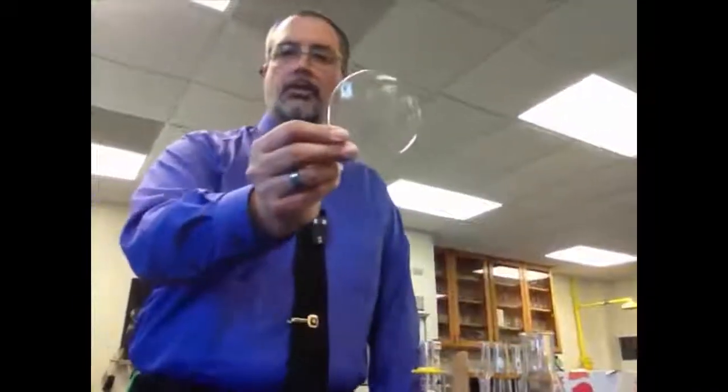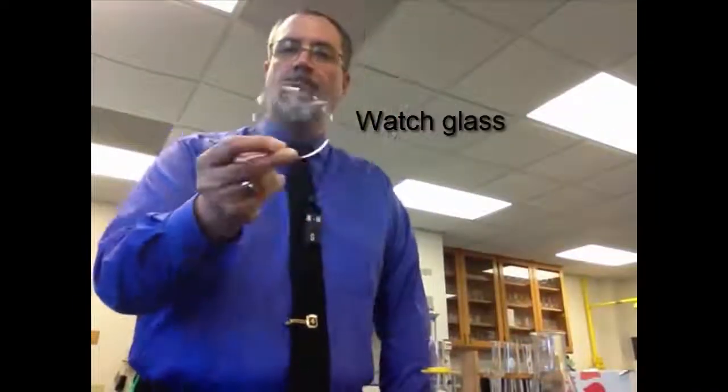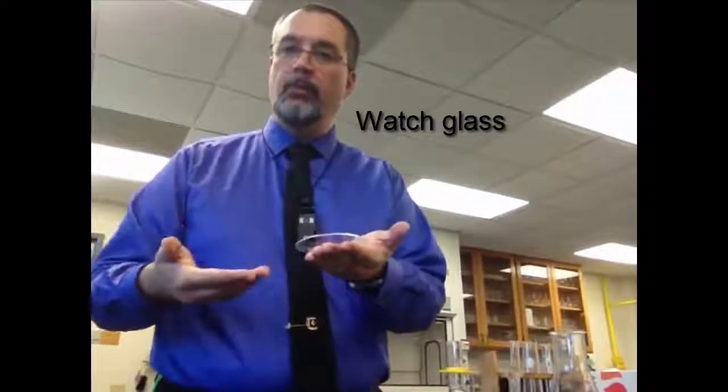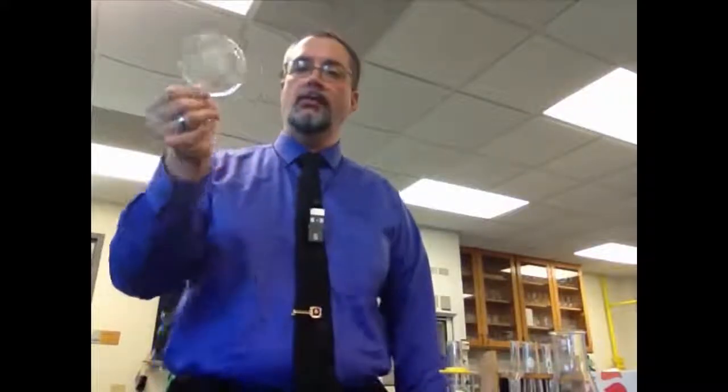This looks like a giant contact lens. It is in fact called a watch glass, and we can use this. We can put something on there to observe it. We don't ever heat a watch glass. Be very careful. Sometimes you might want to heat this. Don't heat this. The Pyrex that it's made out of is pretty fragile, and it'll crack if you try to heat it.